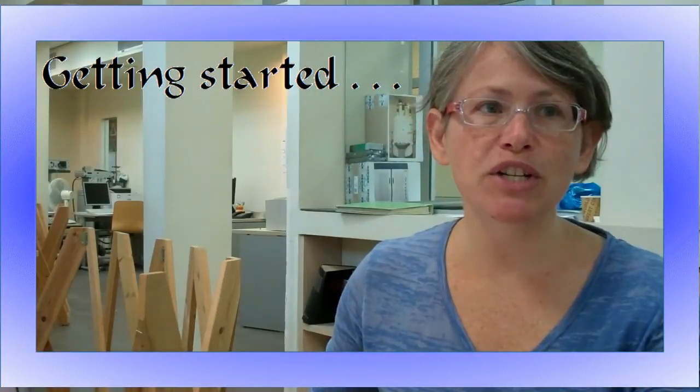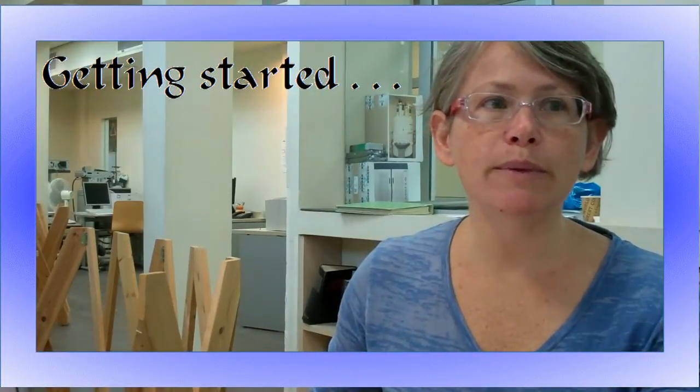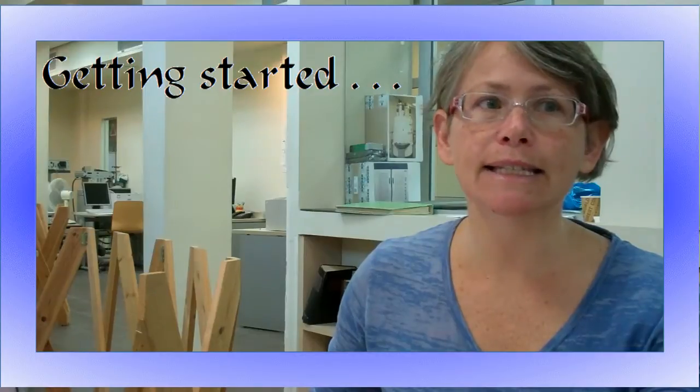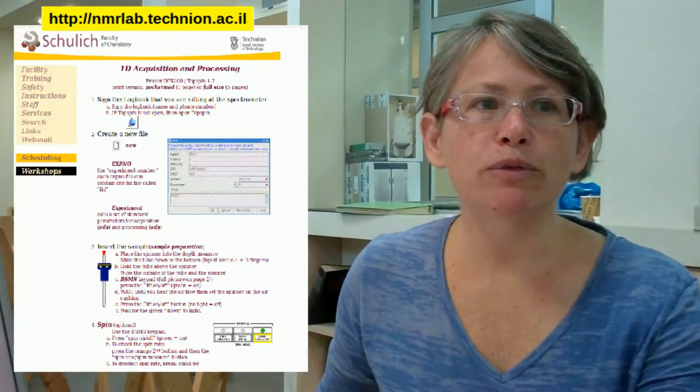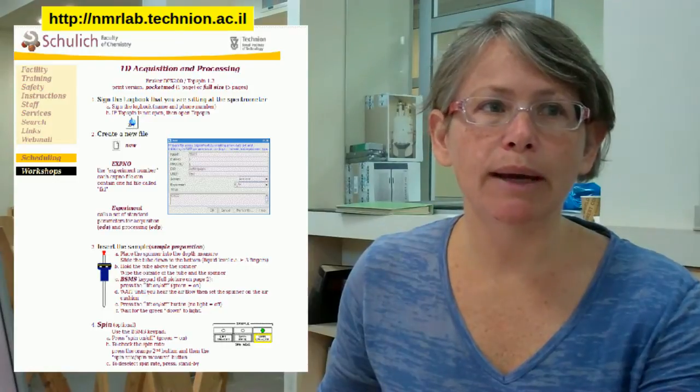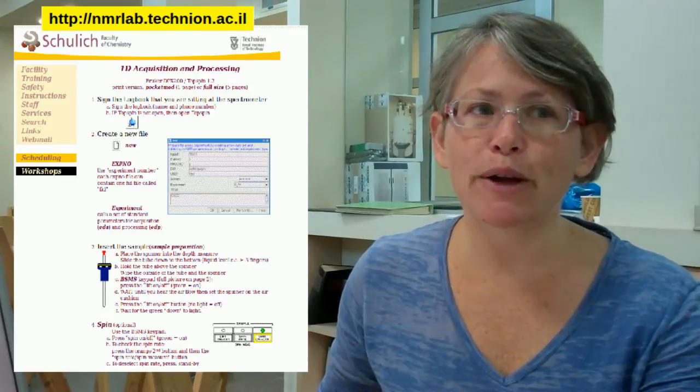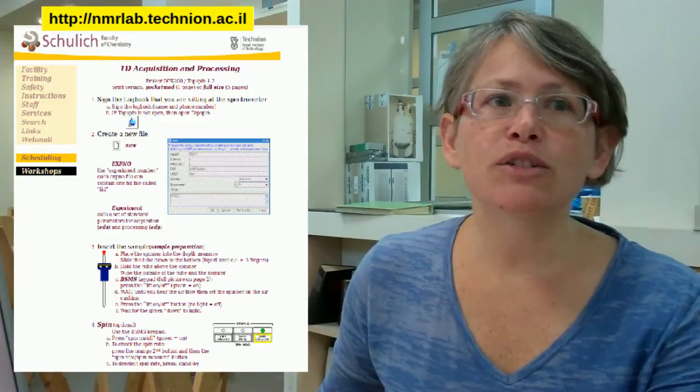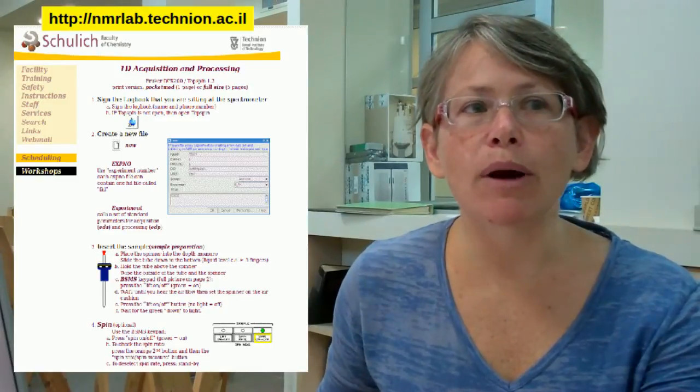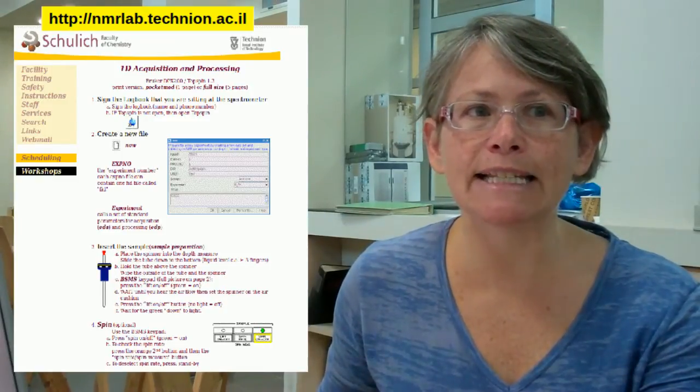This video begins the demonstration lesson, also described online in our training guide as Lesson 1. In the following, I'll be following what's written in our basic instructions line by line, so I recommend having a copy nearby. The instructions are on our website, nmrlab.technion.ac.il.